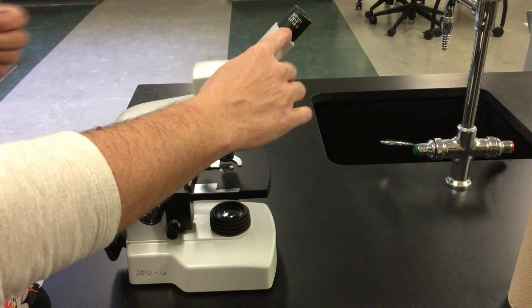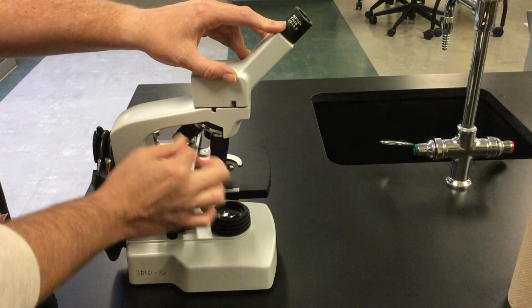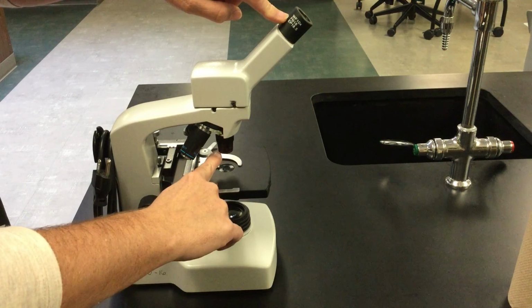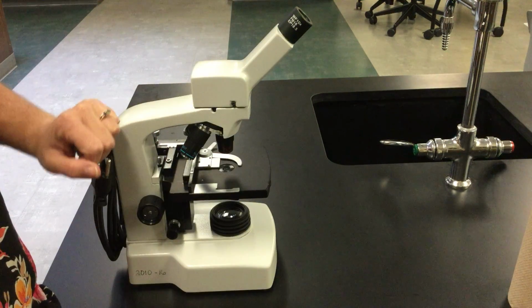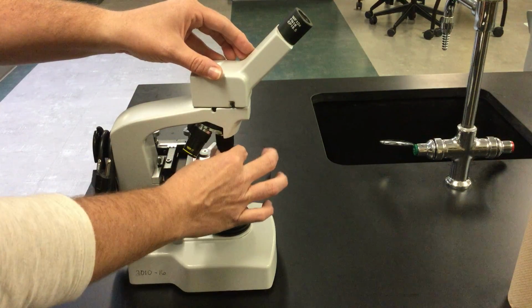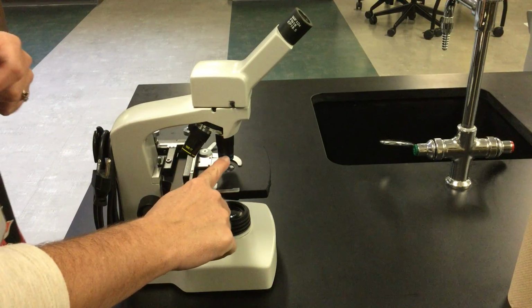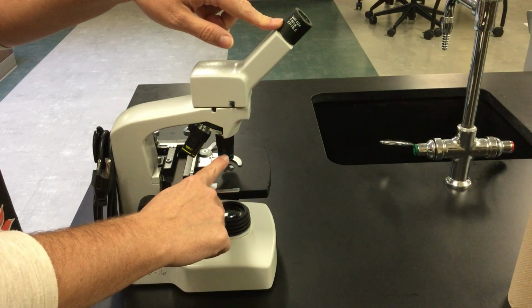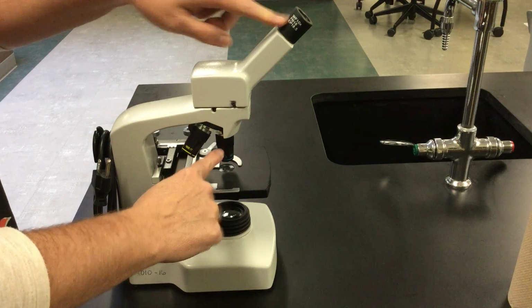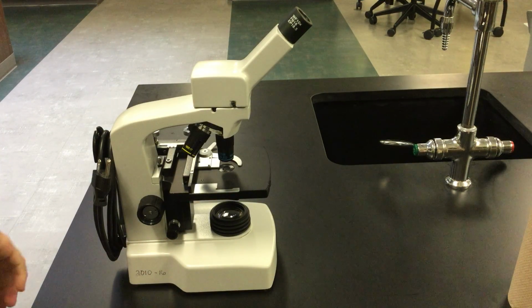larger. So it'll magnify by the 10 up here times whatever objective you're using. If you have it on the 4 objective down here, you're going to take the 10 times the 4 power for a total of 40. It's going to magnify it 40 times larger. For our blue objective, which is a 40 power by itself, and we have our 10 times magnification up here, 10 times 40 gives us 400. And on this setting, we're going to magnify by a power of 400.